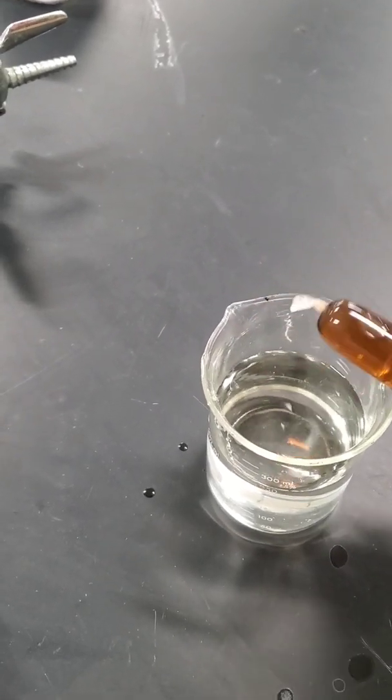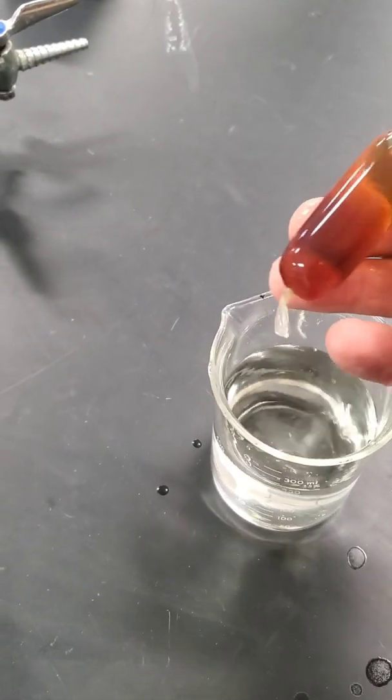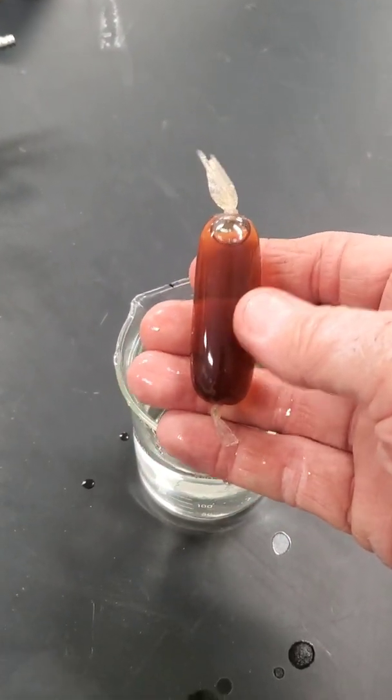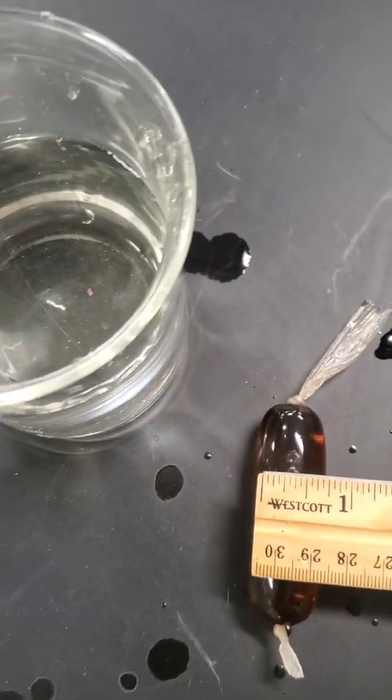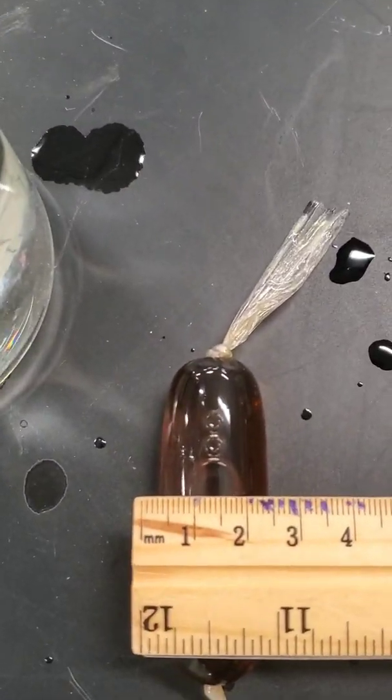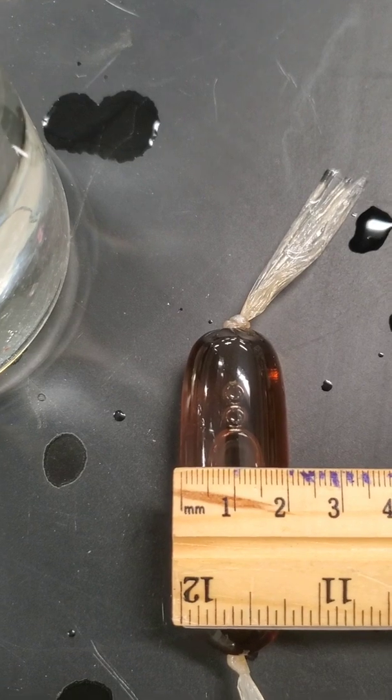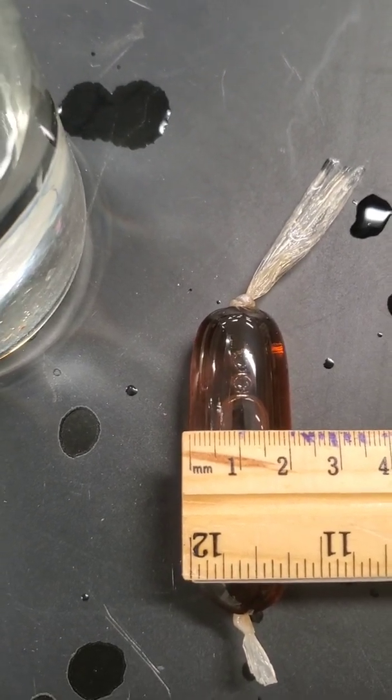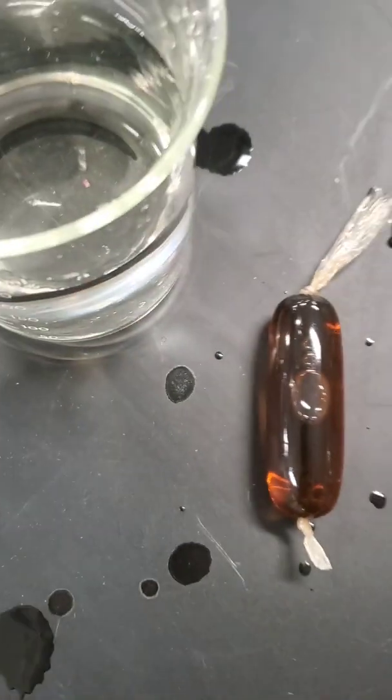Let's see what our little bag's doing now. Look at that, it's pretty swollen up. The question is, why is it getting all swollen up? Checking out our little tube, you can tell it's really swollen up. The diameter of it is about two centimeters or 20 millimeters, so it's gone from 1.5 to 2, so it's really expanded.